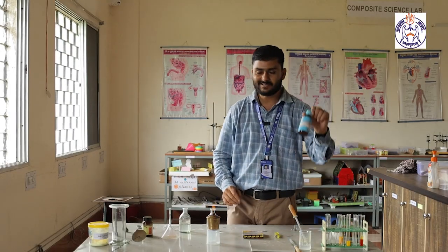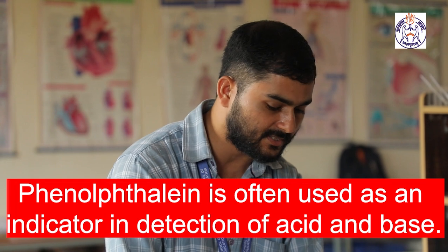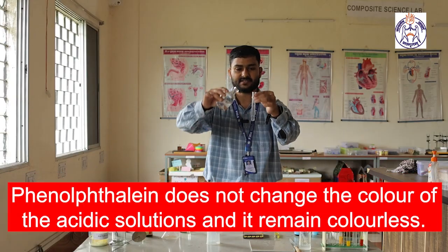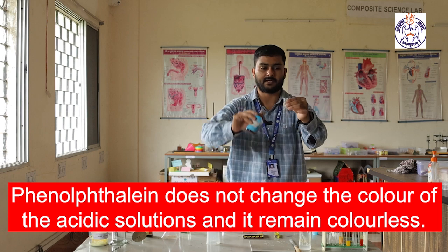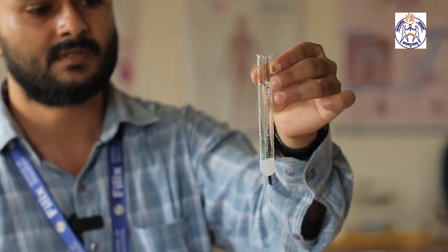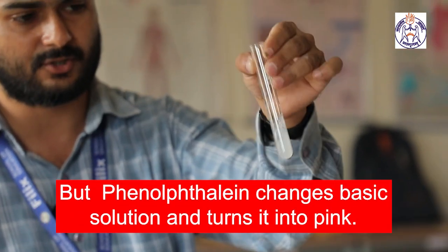Now I have one synthetic indicator also. It is the phenolphthalein solution, and we are going to observe the change of color in presence of acid and base. So in one test tube, I am taking that acid again, that means the dilute H2SO4, and I am adding 1 to 2 drops of phenolphthalein indicator, just 1 to 2 drops is sufficient. Ultimately, there is no color change. Though it looks hazy, it is actually a transparent solution, no color change.